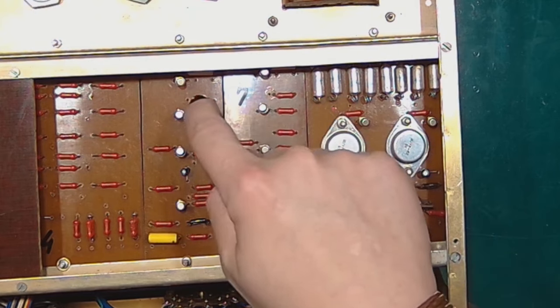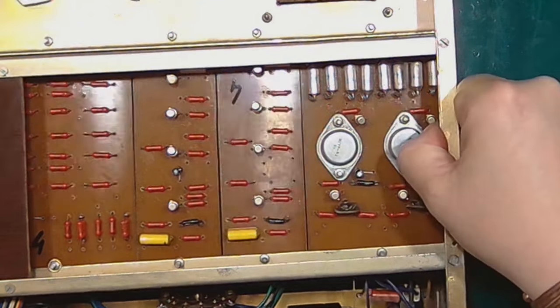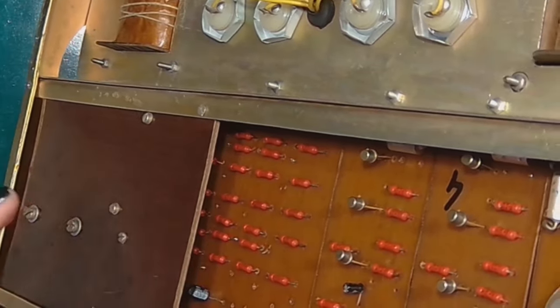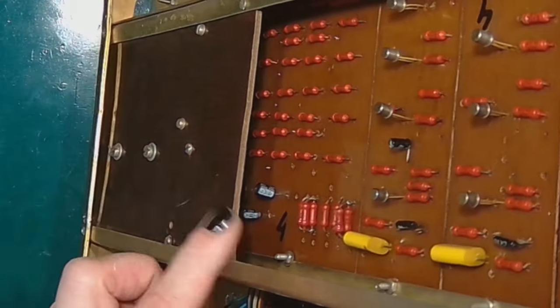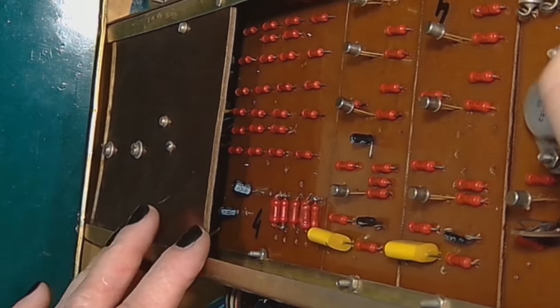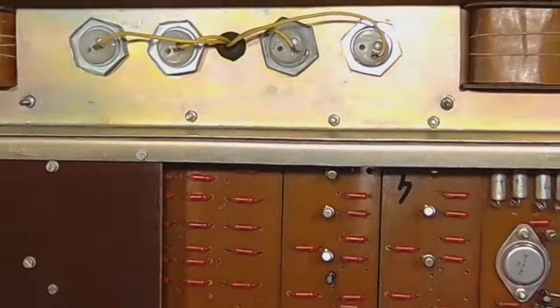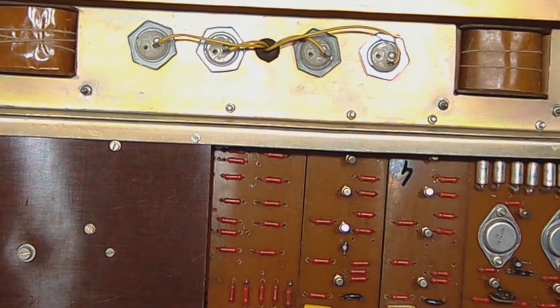So I reverse engineered the timer boards. There's also the resistor ladder board. It also has a few capacitors for setting the time constant. And there are the CAN electrolytics for the DC filter.